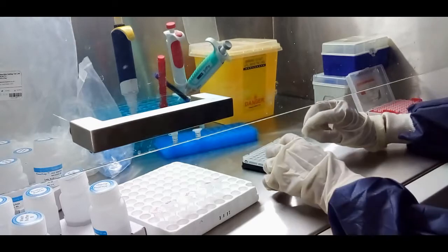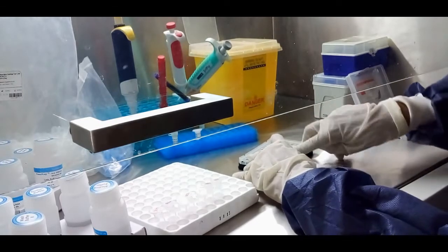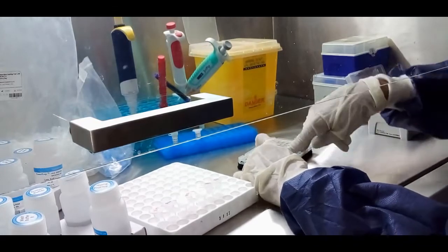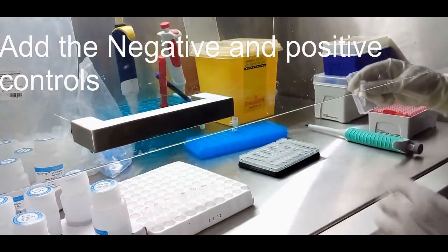Cover back the strip. Add the negative and positive control to each in different tubes.